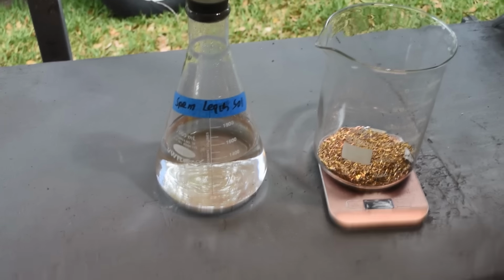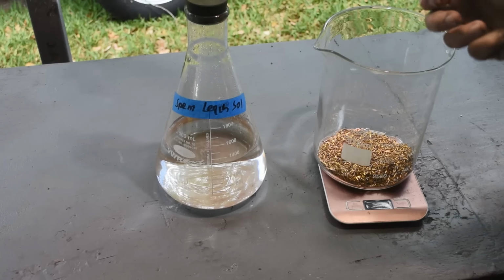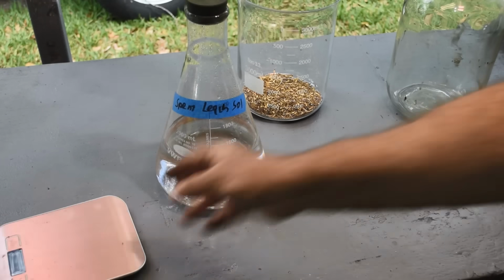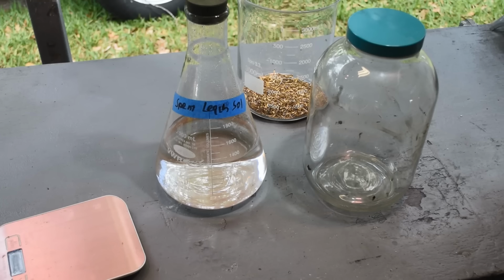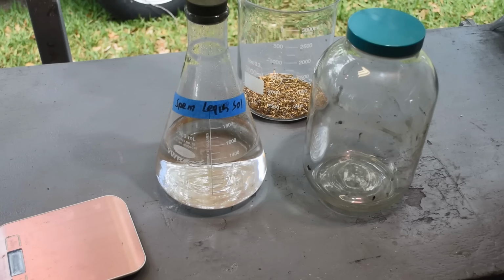So that's my plan. So the question is, how am I going to agitate this differently? Well, let me show you. To start with, we're going to use a different container to do this in. We're not going to do it in a beaker. No. We're going to do it in a great big jar. How does that help, you ask? Well, I suppose I could just stand here and shake it the whole time, but I got a better idea. We're going to put the pins and the liquid in here, and then we're going to do something special with the jar. Let me show you my idea.